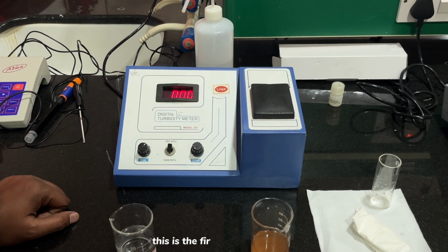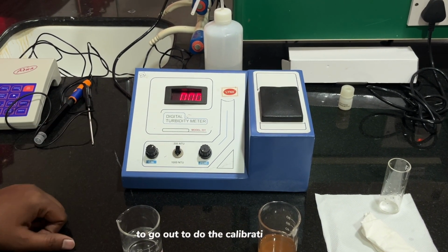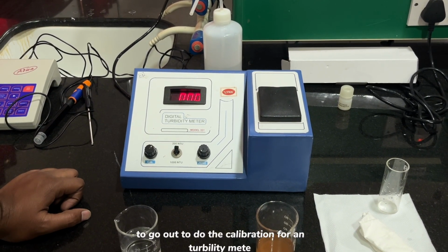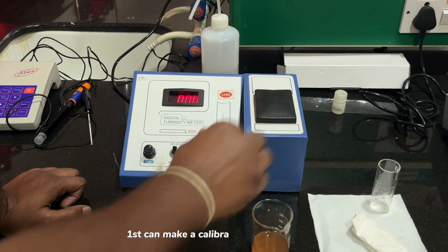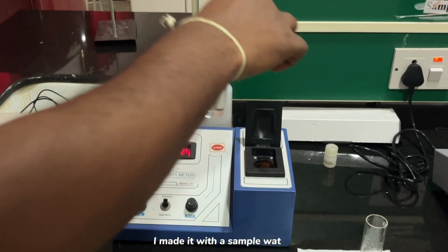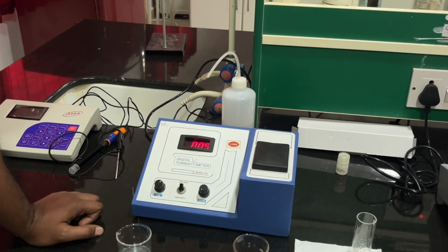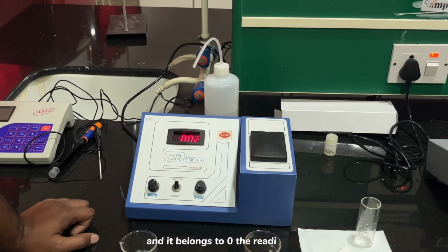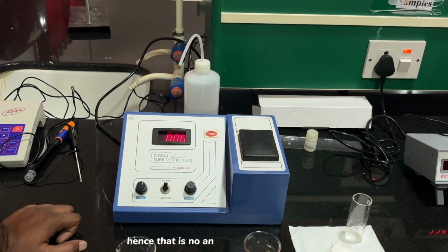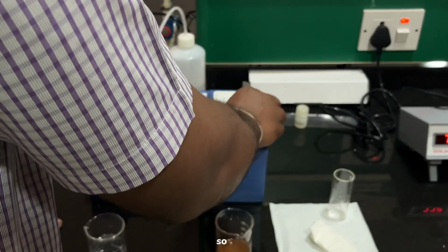This is the first step, to calibrate a turbidity meter. First you make a calibration with a sample water. I have made it with the sample water, and I am keeping it again. Let us watch, and it reads 0. The reading is 0, hence there is no turbidity in the water. You can easily identify this. So this is the calibration.